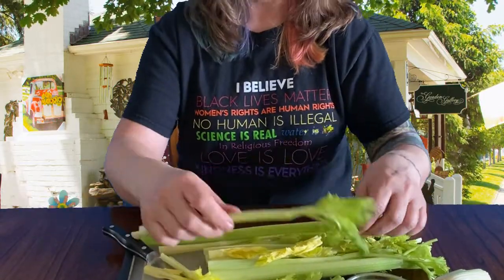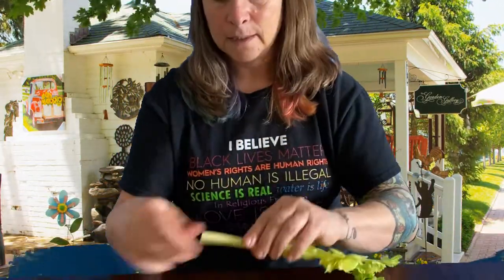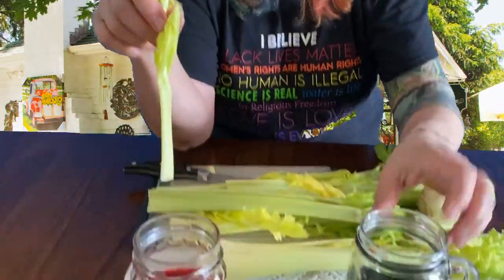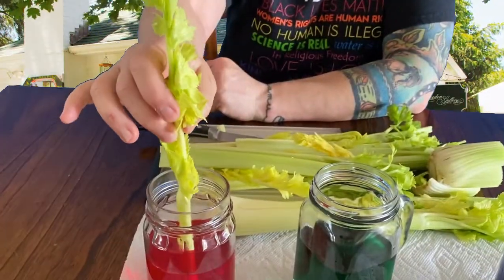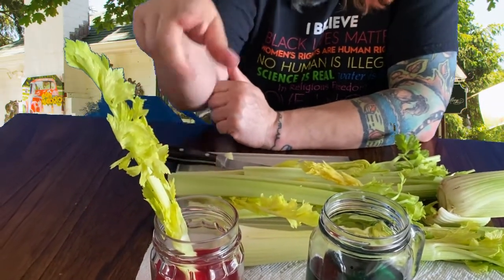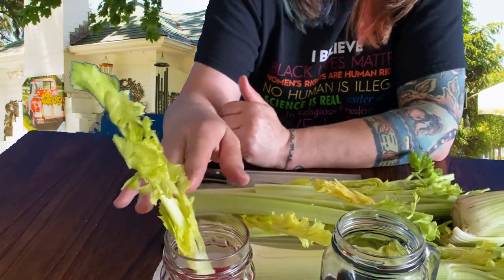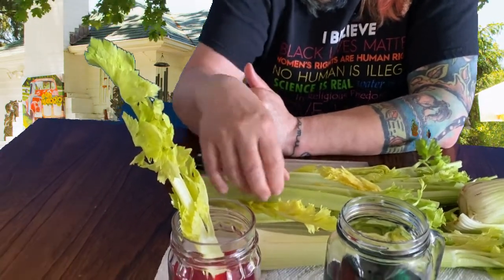I'm going to pick a few out, and this is really easy to set up. That's a good one. Okay, make sure we've got a nice clean cut, and then we're going to put them in water that has food coloring in it. The idea here is that if this water actually does what I told you it does, if it comes up through the stem and out the leaves, it's going to change color because of the food coloring in it. If we check on this in 24 hours, 48 hours, we should notice some different colors in here.